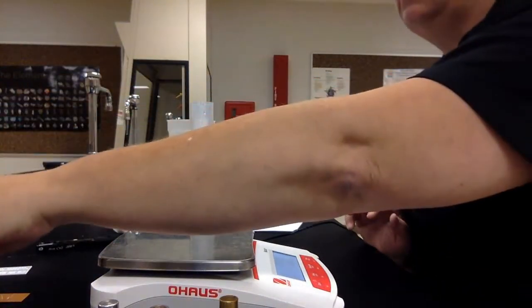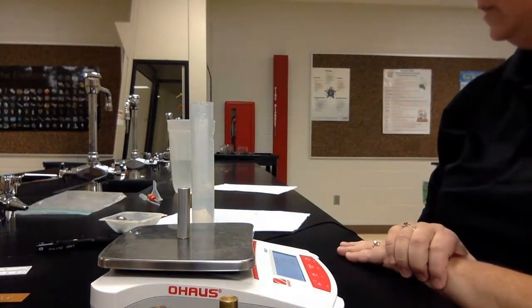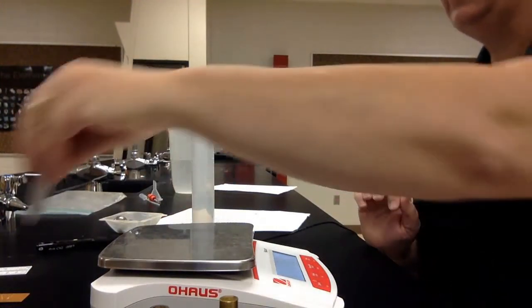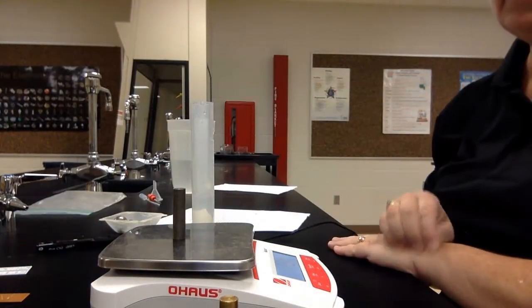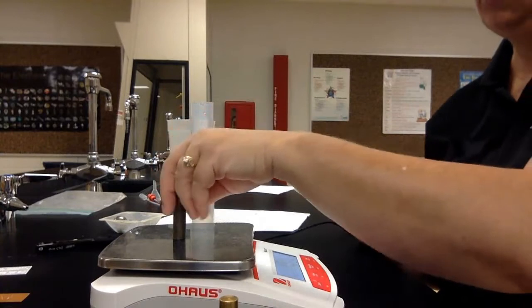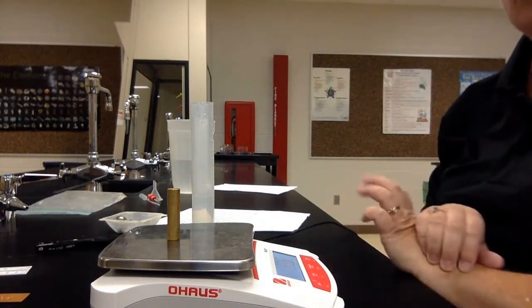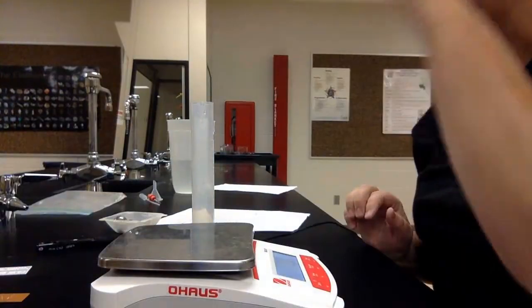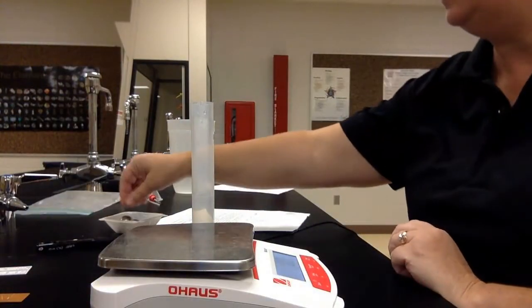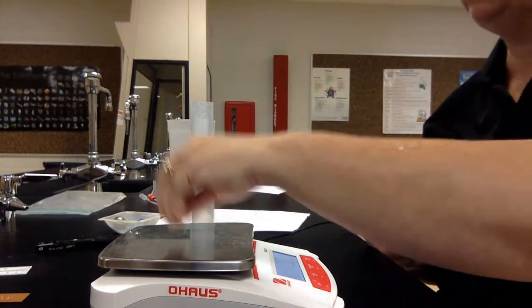Write that one down. The aluminum cylinder, 17.2 grams. Write that one down. The iron cylinder is 49.1 grams. And the yellow brass is 53.6 grams. Remember to have the little g next to each of these numbers. We have no naked numbers. Now, the cork, which is way at the bottom, is 0.6 grams.